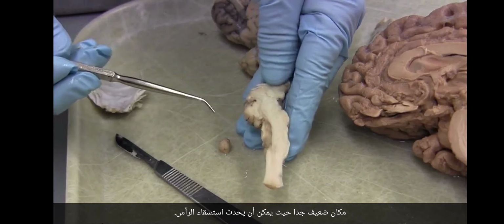It's the same deal on the human, although unfortunately this specimen doesn't have a great medulla, but it's coming out from this middle section and then also out from on either side.